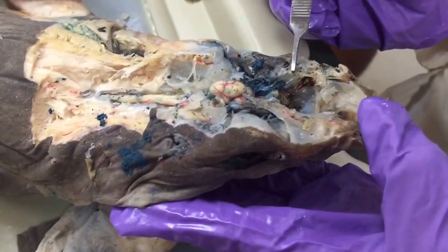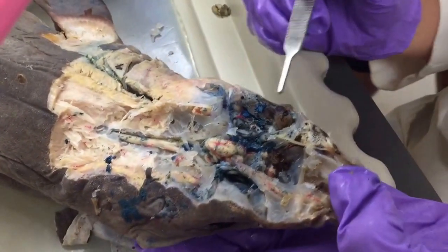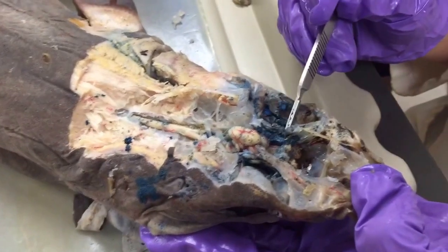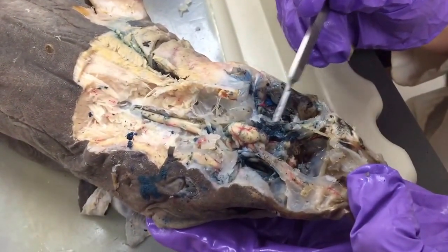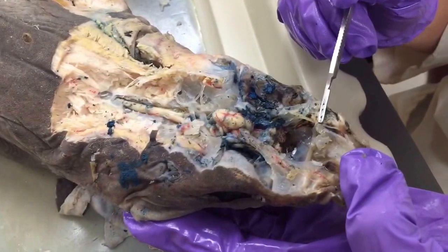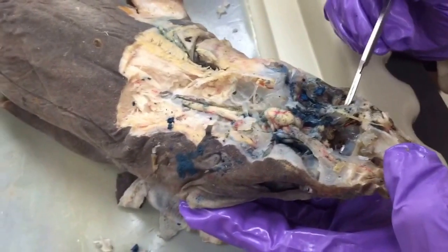Above that is the superficial ophthalmic trunk, which contains cranial nerves 5 and 7. So that's anterior to the orbit here. Within the orbit, the same nerve that combines cranial nerves 5 and 7 is known as the infraorbital trunk. So it's infraorbital trunk here, and what was it? Superficial ophthalmic? Right, superficial ophthalmic trunk here.